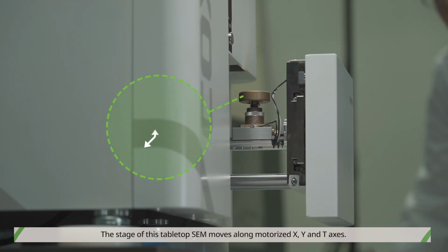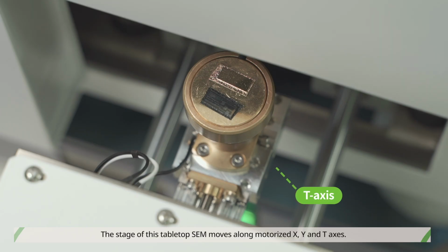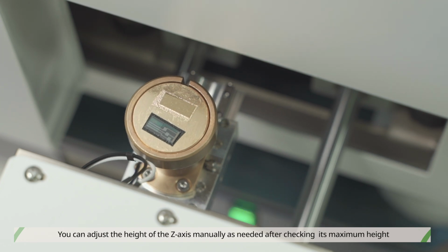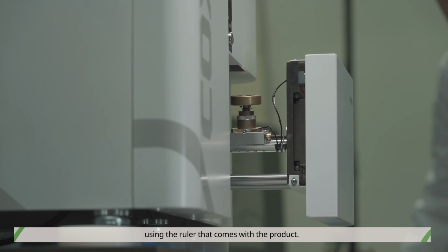The stage of this tabletop SEM moves along motorized X, Y, and T axes. You can adjust the height of the Z axis manually as needed after checking its maximum height using the ruler that comes with the product.